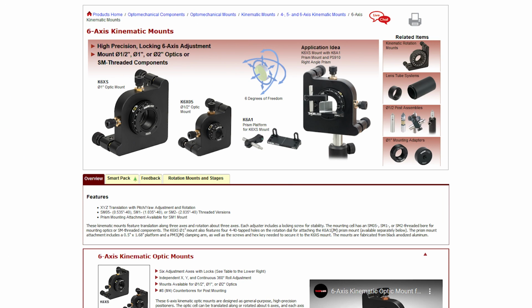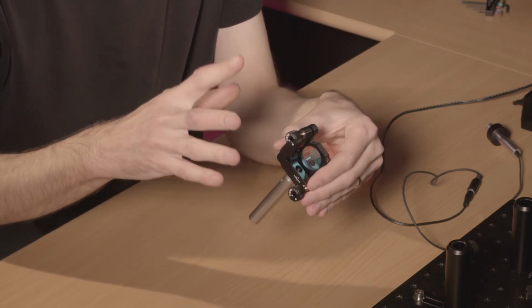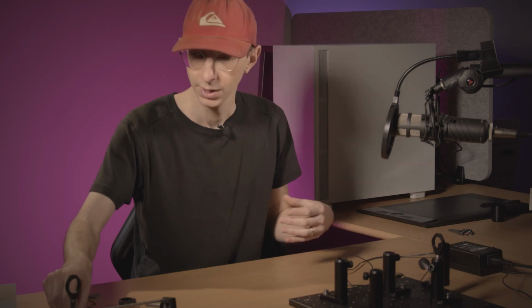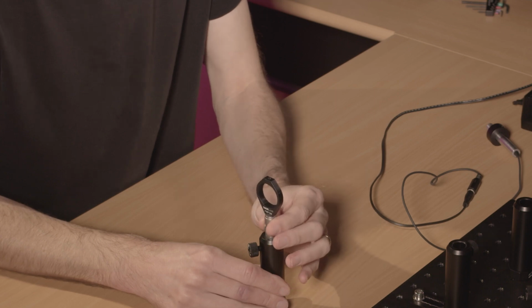So we could use, in theory, something that would tilt the laser and move it laterally, but if you check at Thorlabs, this kind of system is relatively expensive. So it's more convenient to use systems that are based on mirrors. You will use two mirrors like these mounted on kinematic base. It's really important to use a kinematic system where you have fine adjustment of the mirror position, because if you use these traditional posts like this one, you are not getting any fine adjustment at all, so it's very coarse.